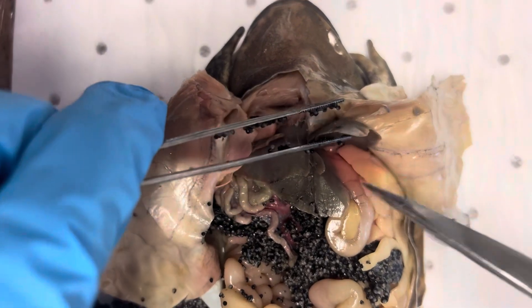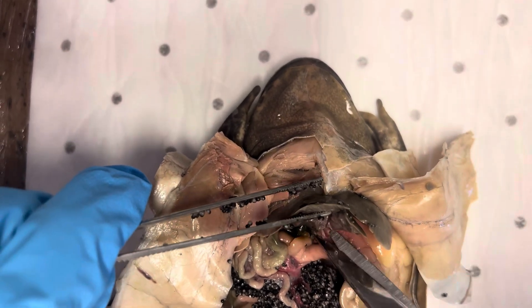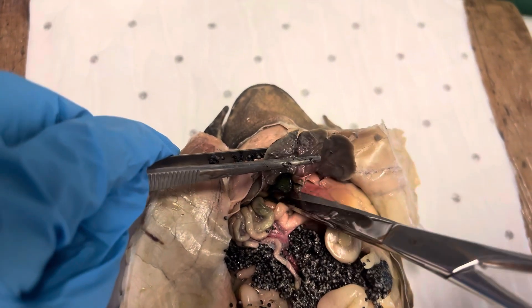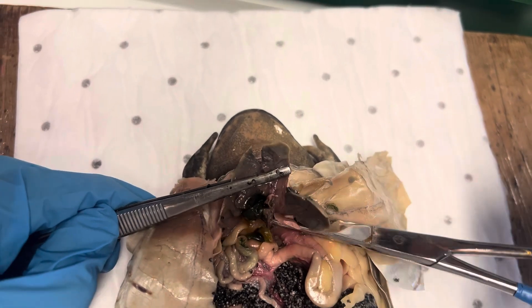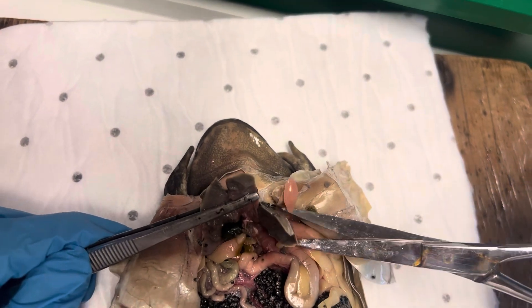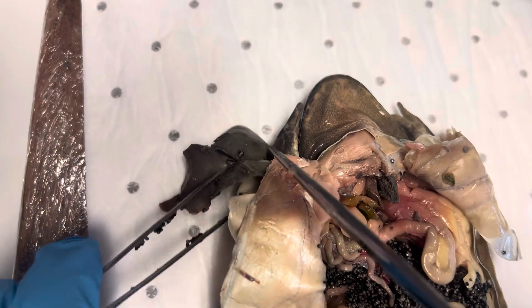From there we can look at the three liver lobes — that's one, two, three. We can snip the liver out very carefully, right up to the top. There we have the liver, and there we have the gallbladder — looks like a shrunken pea. That's the gallbladder. It's quite big — it's quite big for the organs.